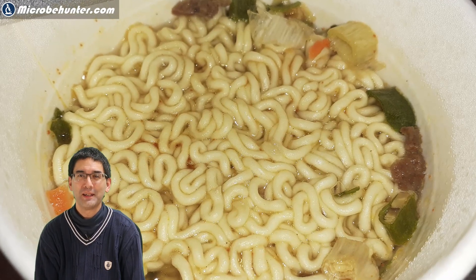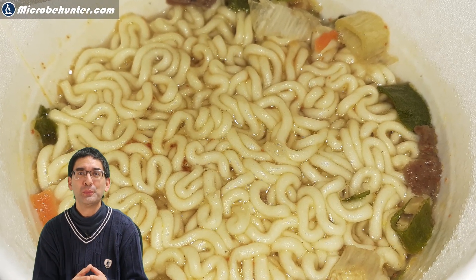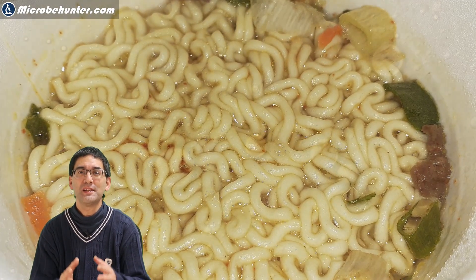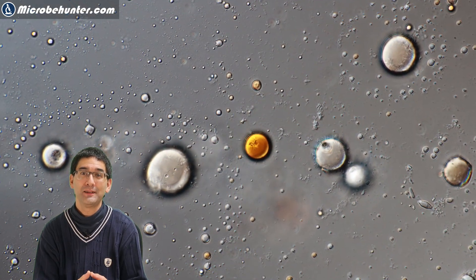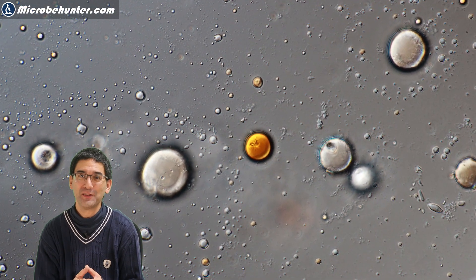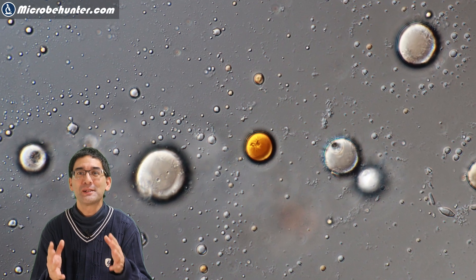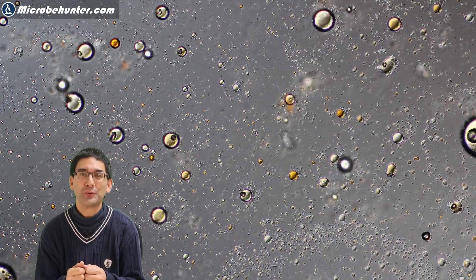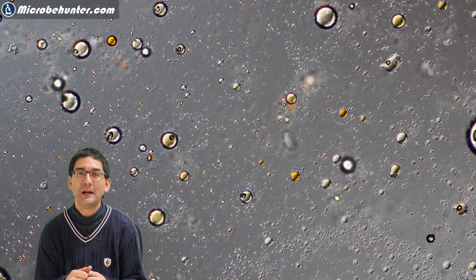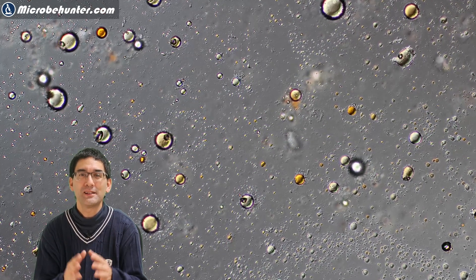Hi, MicrobeHunter here again. Today I want to put some spicy ramen soup under the microscope. And yes, there is a lot of science involved here. I have seen something that made me wonder a little bit. But not to worry, the ramen itself was fine.